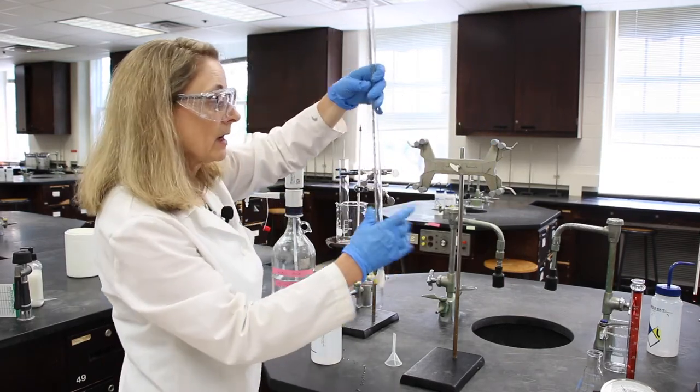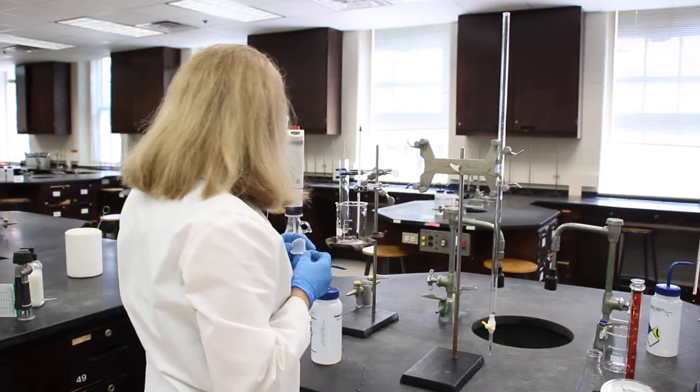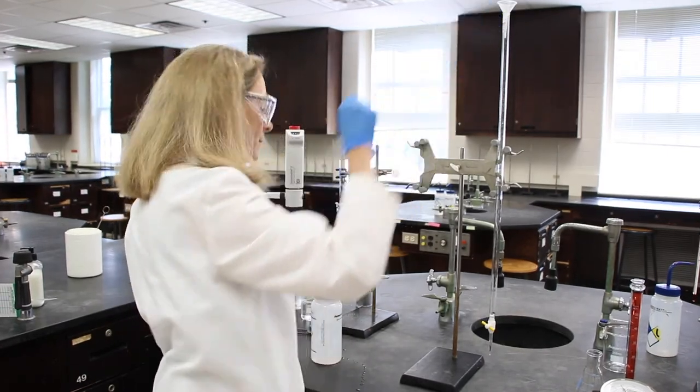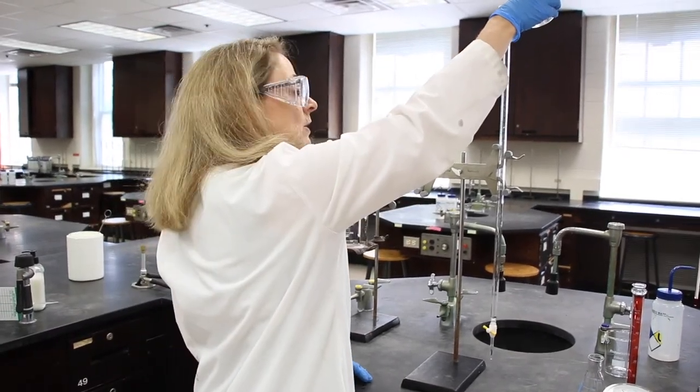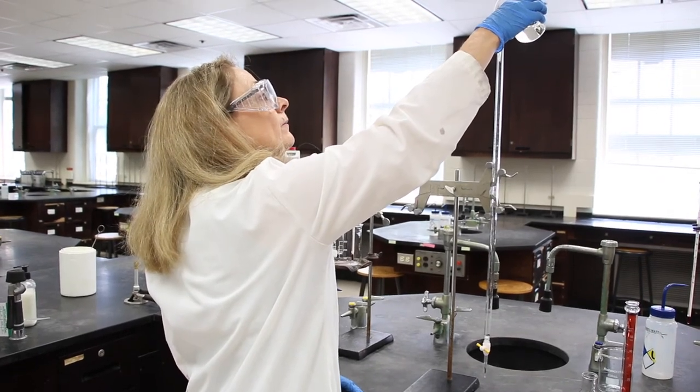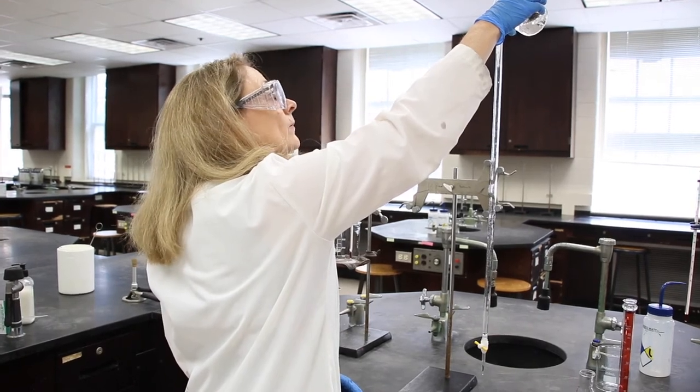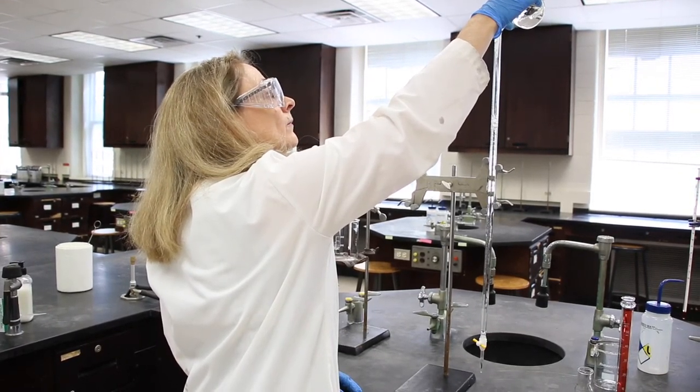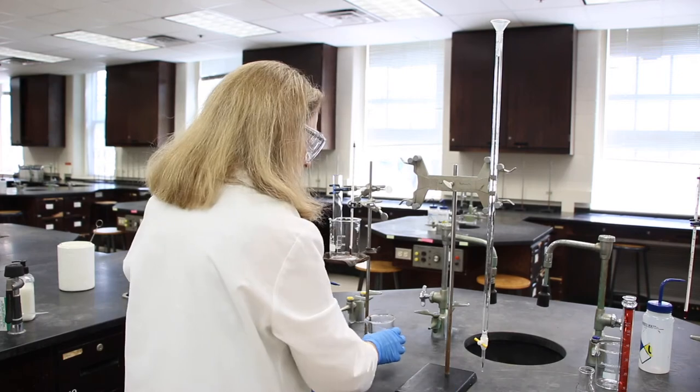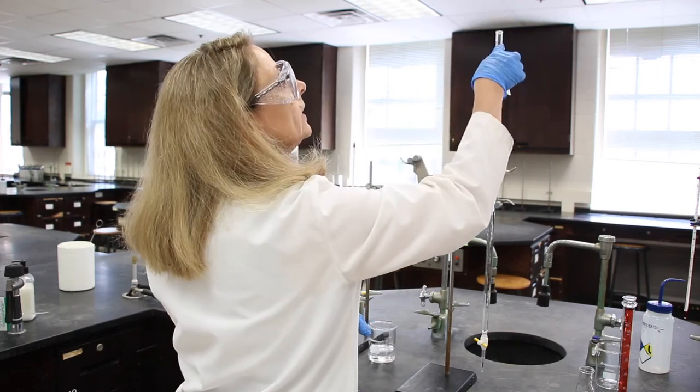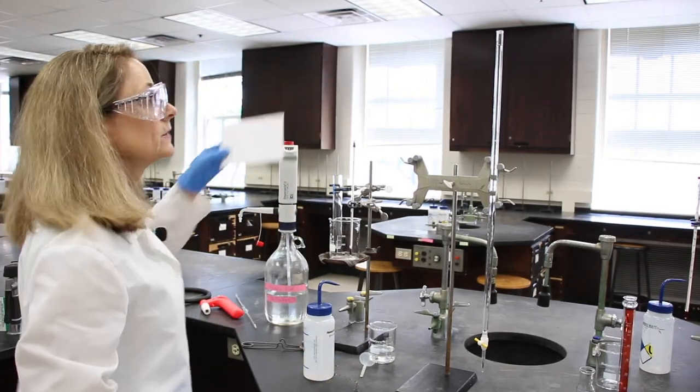We'll close the stopcock and put it back in the burette clamp and then I'll put a burette funnel in. I've got some DI water in a beaker and we are going to be filling up our burette.